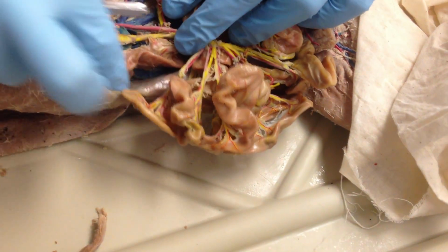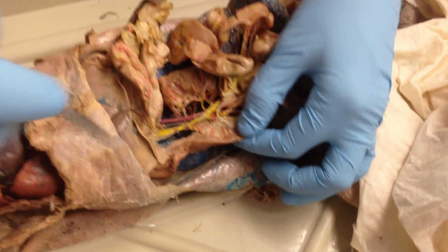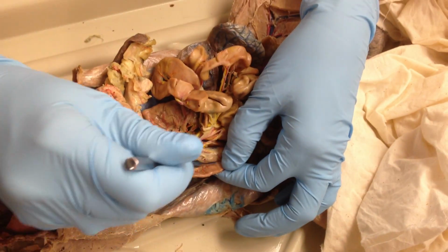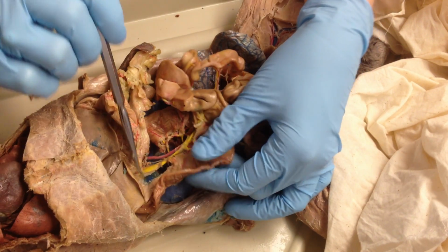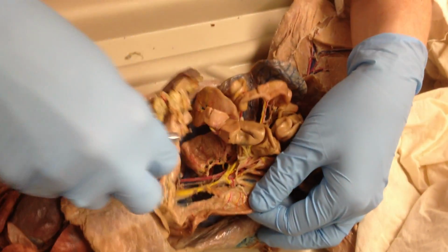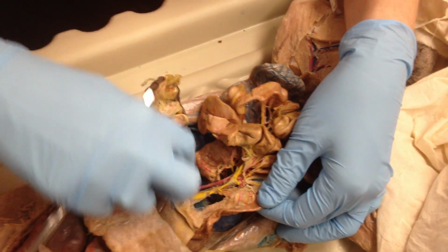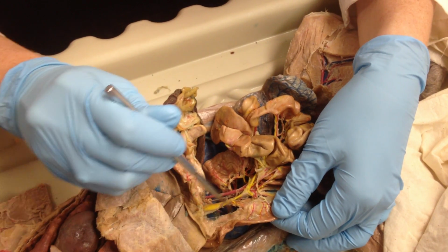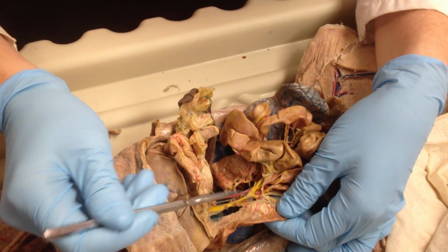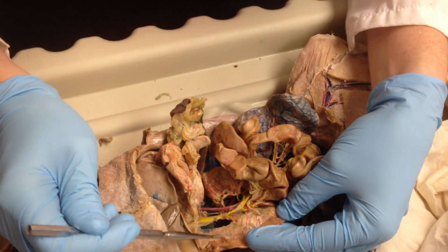The last thing to be aware of is the pancreaticoduodenal, for which you need to find the duodenum portion of the small intestine first. Running alongside of it is a portion of the pancreas. You have one part of the pancreas coming up this direction here. That's the main portion, and this small portion comes down the duodenum. So pancreaticoduodenal, shockingly, runs between the duodenum and the pancreas.